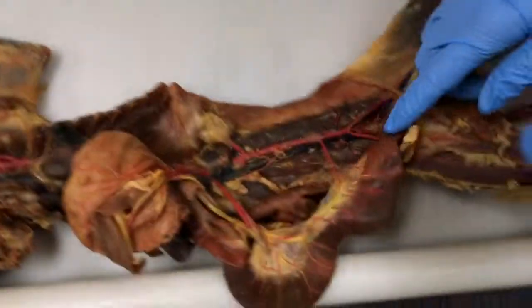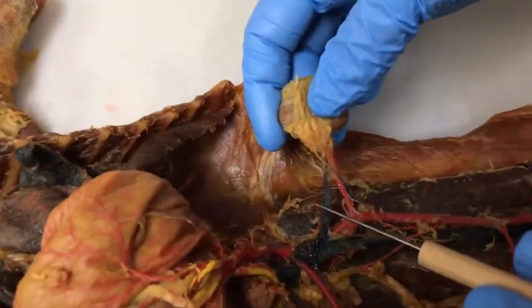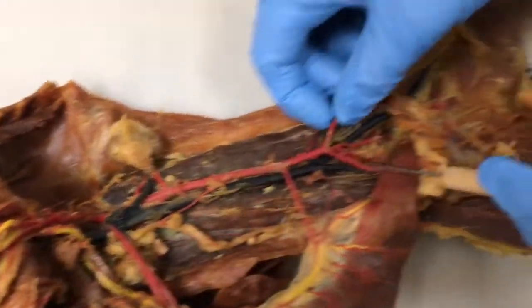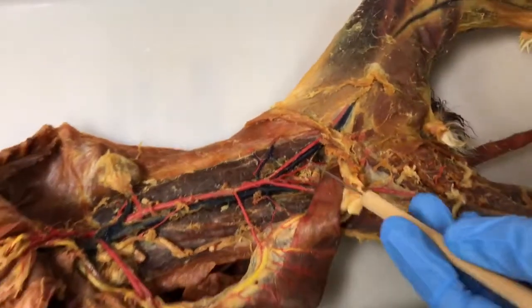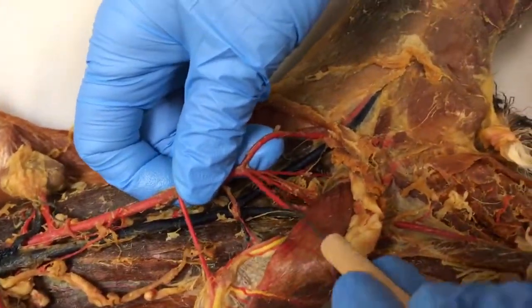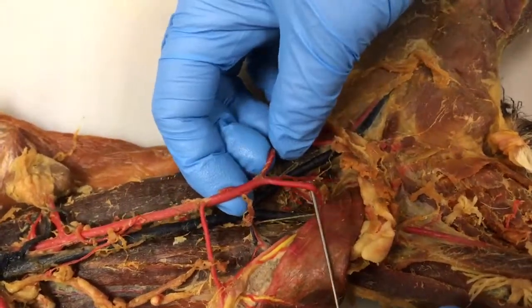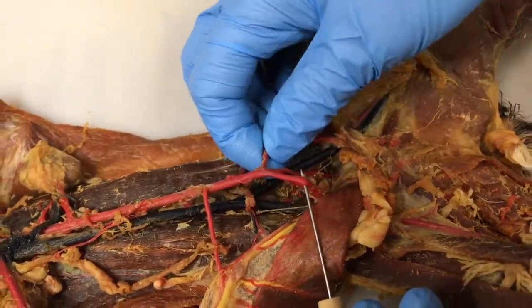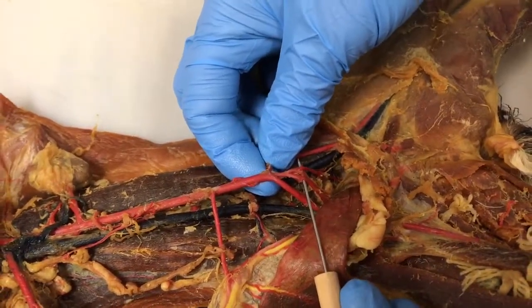From there, we could look at the kidneys. You got the renal artery, renal vein, and then down here you got a few triangles. A little bit different from the human. Let's start with the cat. It's kind of like we have a triangle on the outside and a triangle on the inside. It's not that bad. External iliac artery, and then you have internal iliac artery.